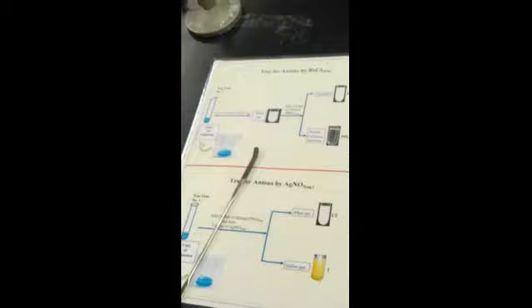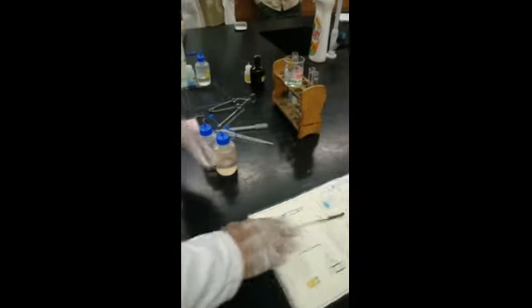So you have finished 4 tests. This experiment is very simple. Why? Because they give you the card. You just prepare the solution, 4 test tubes, and follow up. One test tube, do the test; second test tube, do the test, cation. Then the 3rd and 4th, do the test and get the answer for anion. Then how to record it? Let us see that one.